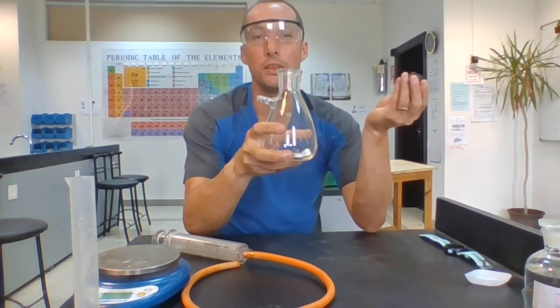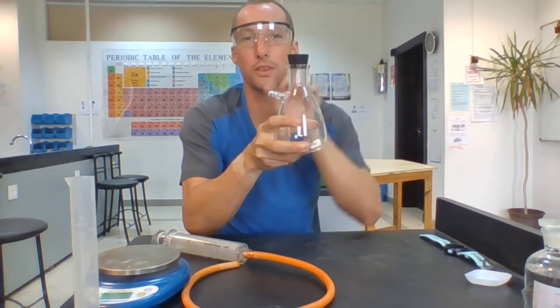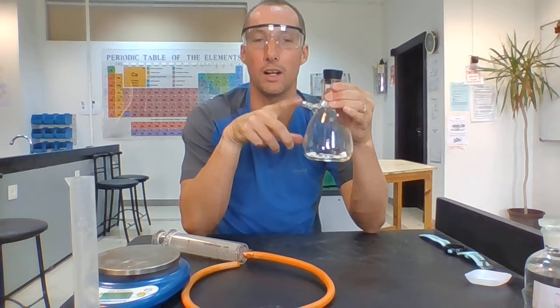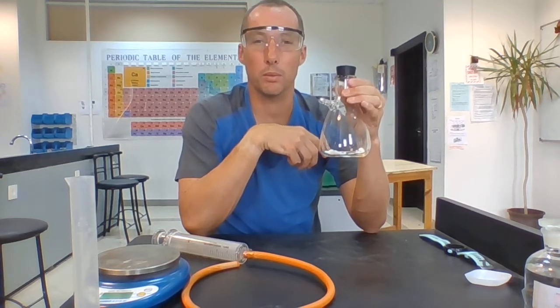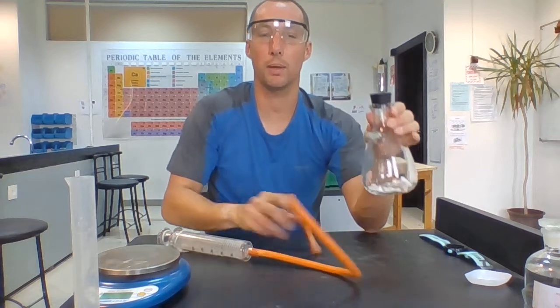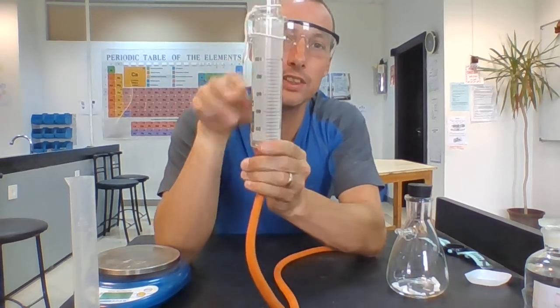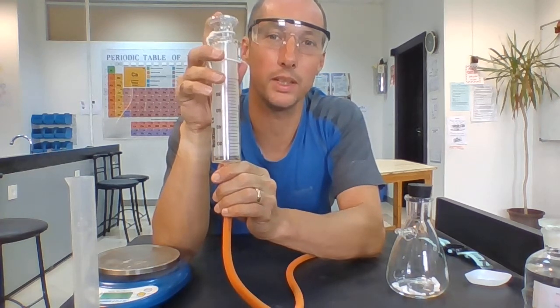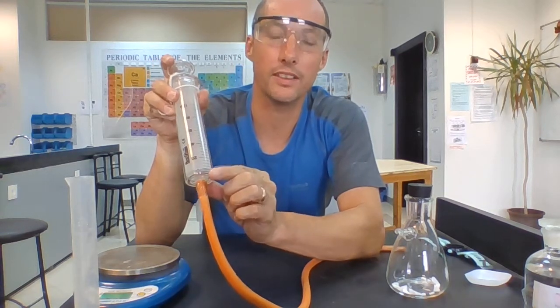That carbon dioxide gas is going to bubble up to the top and it's going to escape into the flask. Now if the top was open, the carbon dioxide gas would escape out into the atmosphere. Okay, top's not open, so the only way it can get out is through this side arm. Now I'm going to force it to go out exactly where I want. And where do I want it to go? I want it to go through this pipe into what we call a gas syringe. Now the gas syringe has got volume measurements on the side of it. Okay, now at the moment it's completely closed. Okay, and that means that it says there's 0 volume of gas inside it.